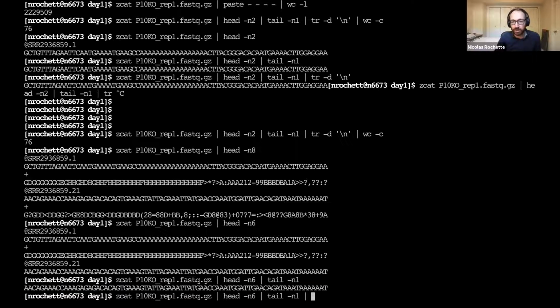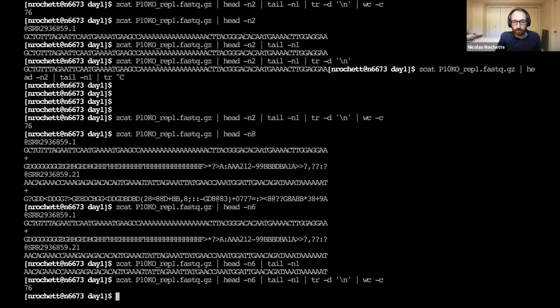And I can apply the same. It is, but we can see it's the same length, but I could apply the same series of commands, and again, you have many ways to do this. I don't want to make things more confusing, so I'm just going to show this one, which is maybe the most basic one. And we could do this for all of the sequences.